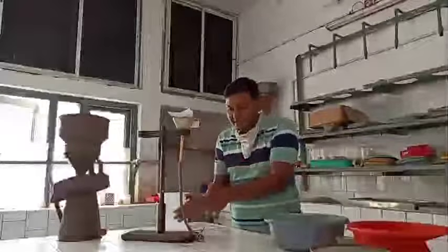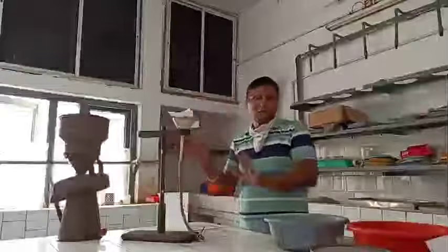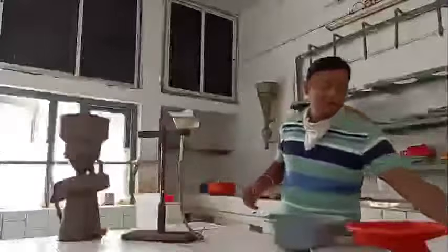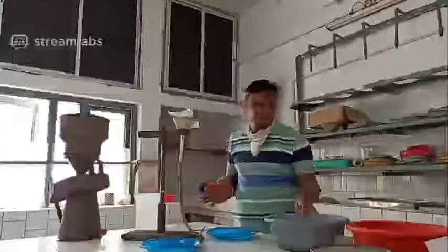This whole assembly is already filled with water. So this is the Baermann funnel technique. We are also using this method now, and it is a very easy method. The merits and demerits we will discuss later after discussing all three methods.